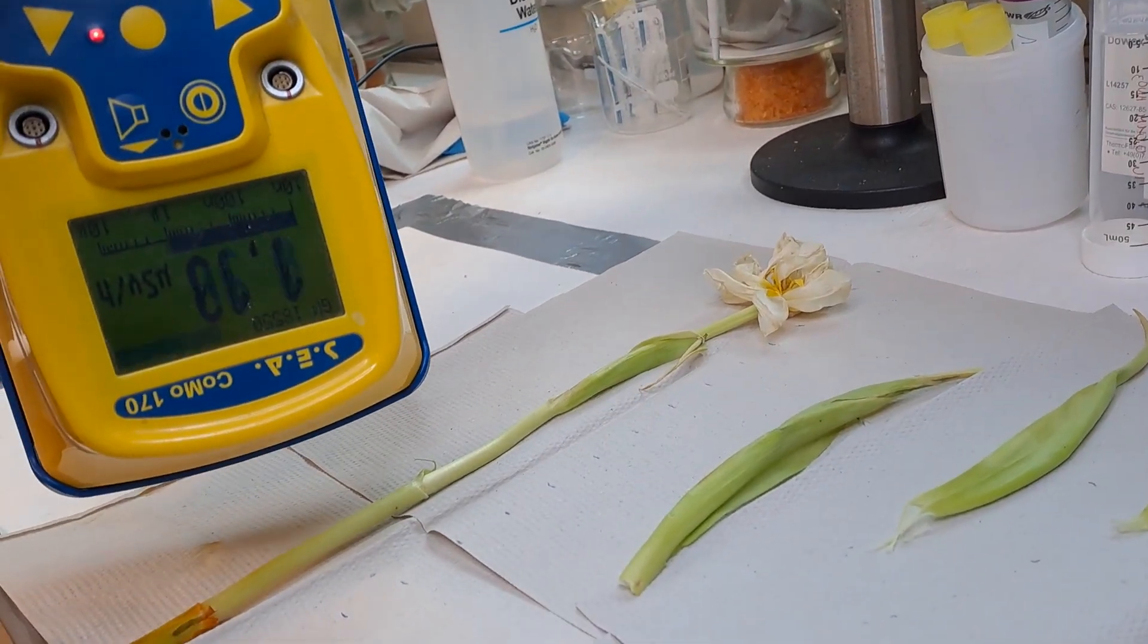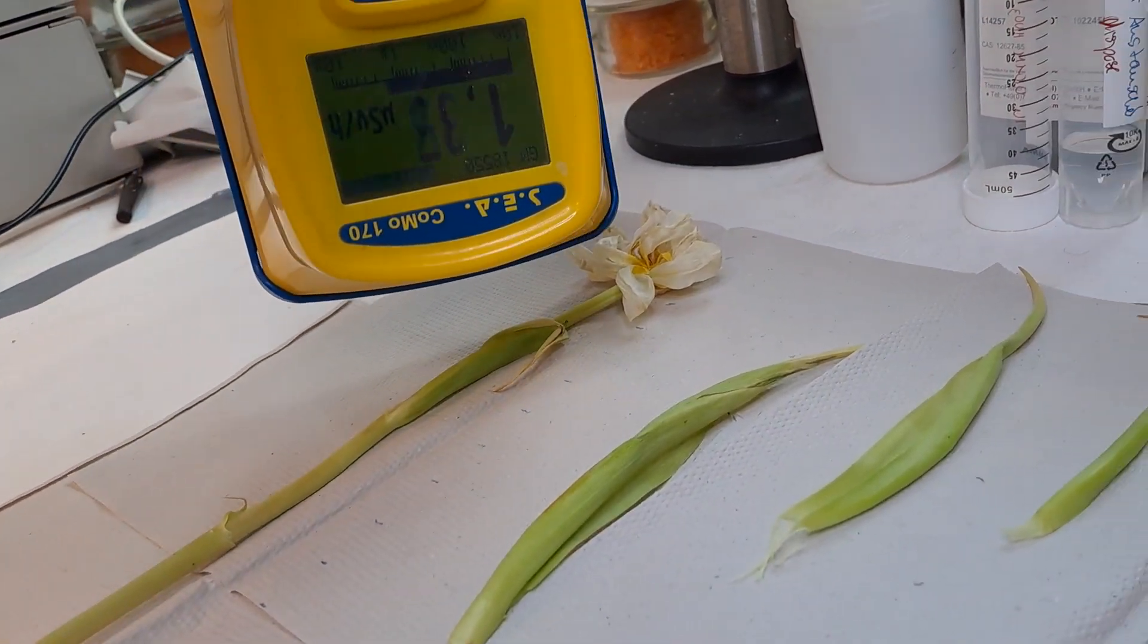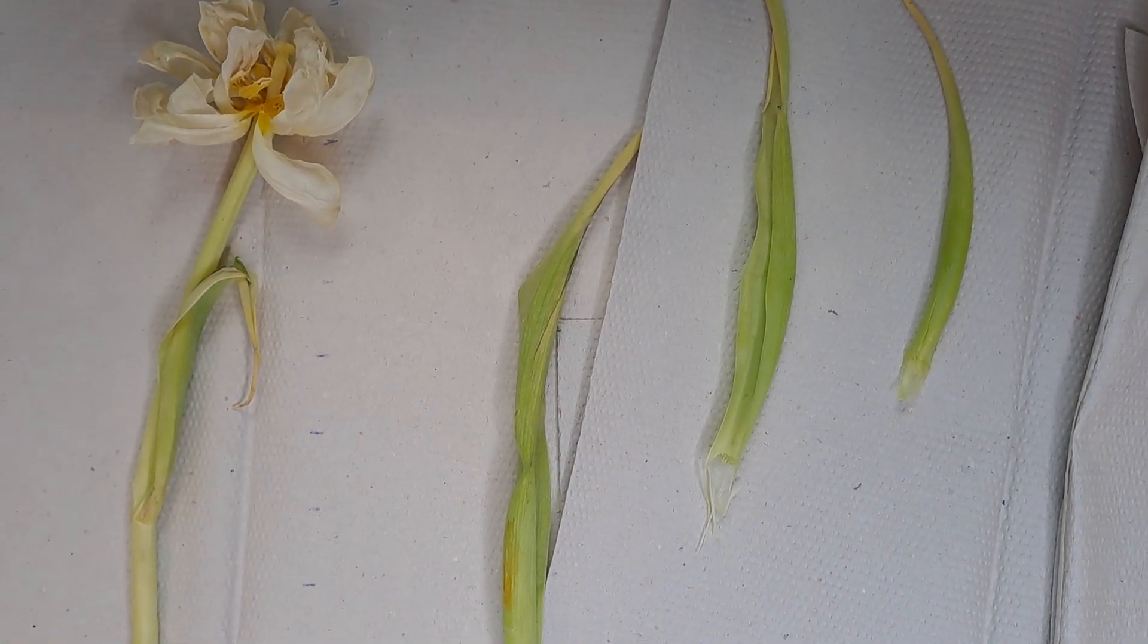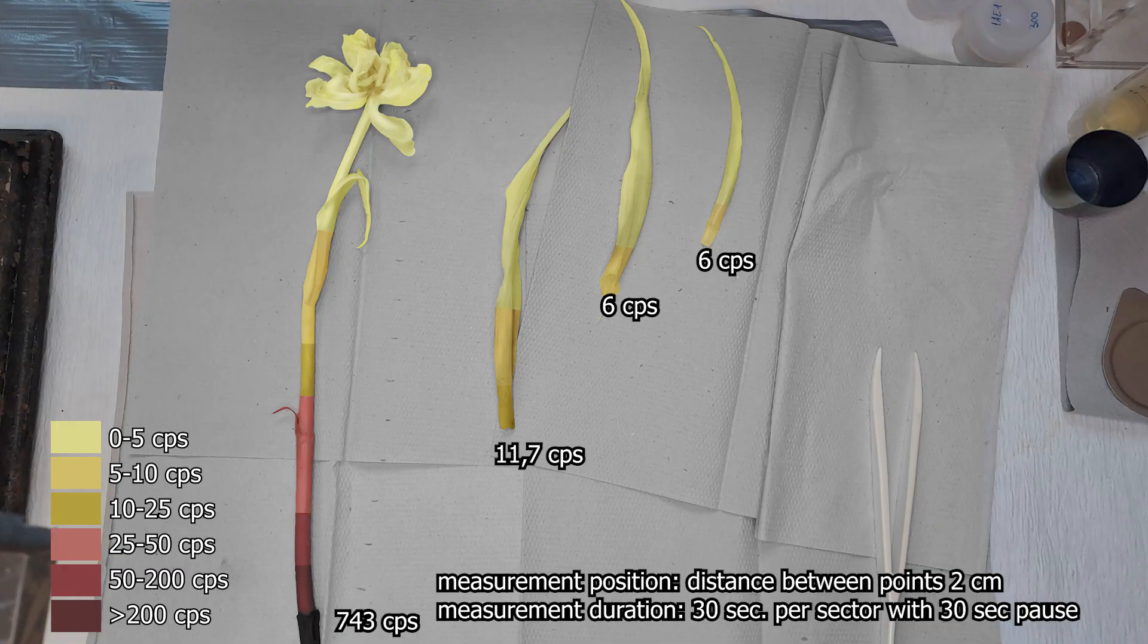The dose rate was moderately low at one microsieverts an hour. With the measurements done, what does the distribution of phosphorus-32 look like in the plant? The activity was increased at the base of the leaves.